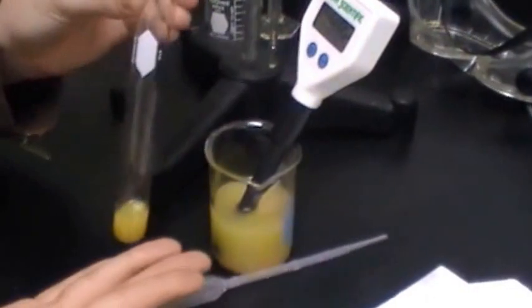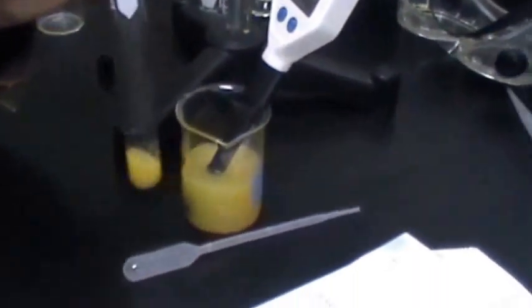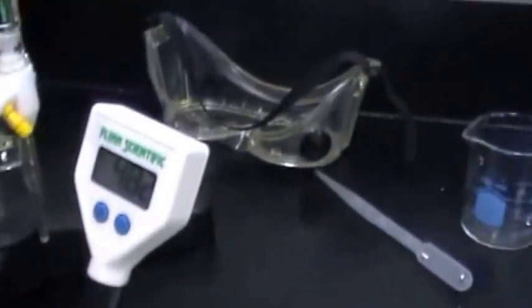It is a little diluted with the water, but it looks pretty much alright. Rana is recording the pH of our solution with nine drops. This is exciting because our pH meter broke. We are now using pH strips for each milliliter. We're on milliliter number nine.